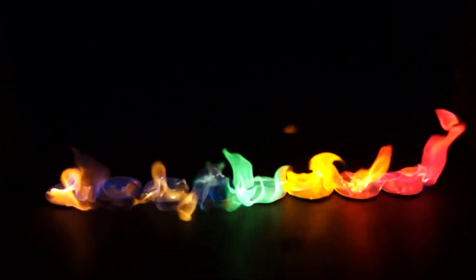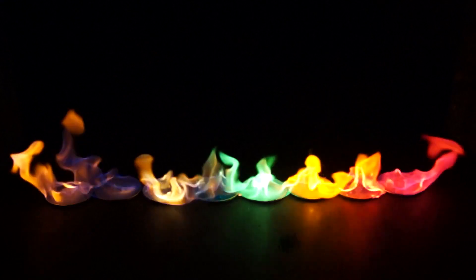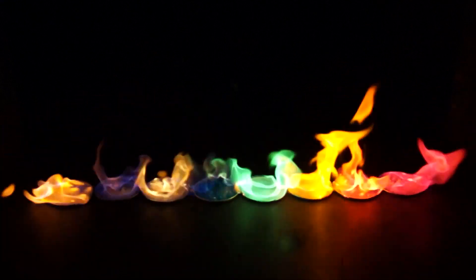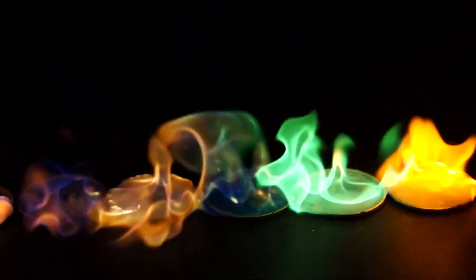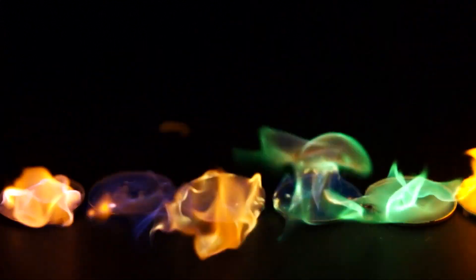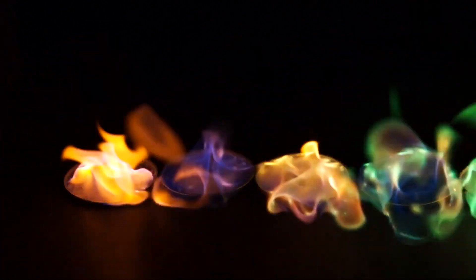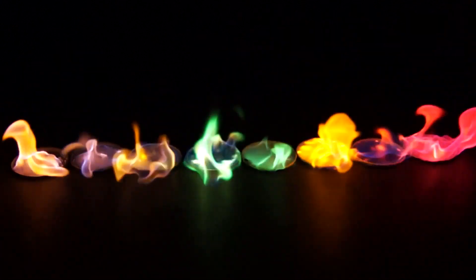Next, boric acid dyes the flame in a rich green color. Bluestone colors the flame in a dim green. Barium chloride should also paint the flame in green color, although we don't observe that here. Lead nitrate paints flame in such a yellow-blue color. Finally, potassium chloride colors the flame in such a yellow-purple color.